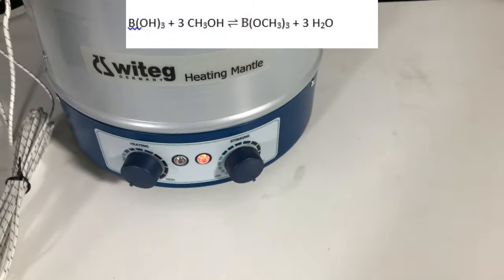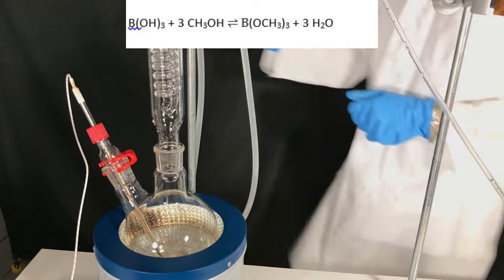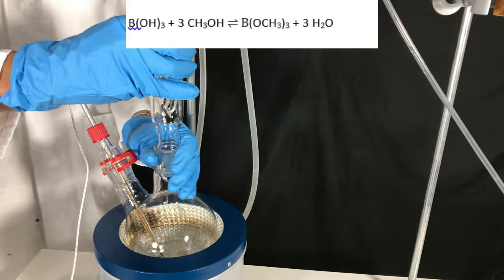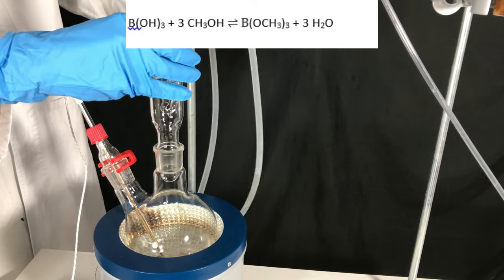The boric acid reacts with methanol to form tri-methyl borate and water. Sulfuric acid acts as a dehydration agent and as a catalyst. Therefore, the equilibrium reaction is driven more to the right side.